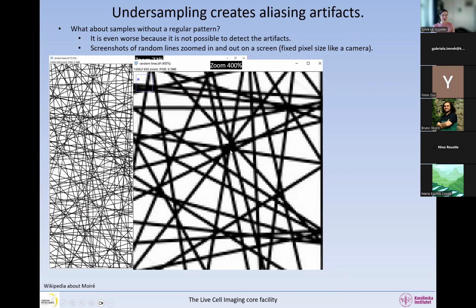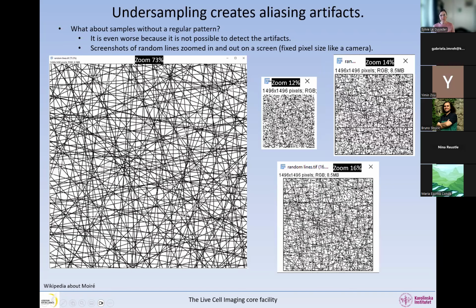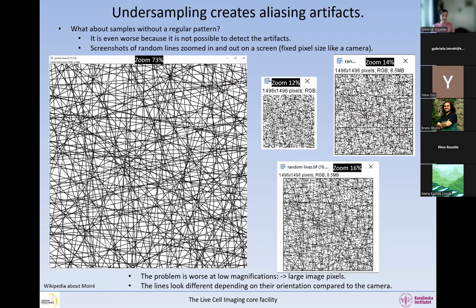So clearly the lines are not like this normally. But now if we zoom out, this is what we see. So it's the same image, just zoomed out, screenshot. And you can see that at different zooms, so different types of undersampling, I get different images altogether. Here I hardly have any lines, and here I have some lines and some jagged lines and everything. And the results that you're getting depend on the orientation of the object. So it's a bit random, and you get completely different images depending on how you undersample. So the problem is worse at low magnification, because we have large pixels. And the lines look completely different depending on their orientation compared to the camera, which is actually a screenshot. Okay, so this is a little bit what happens in our samples.